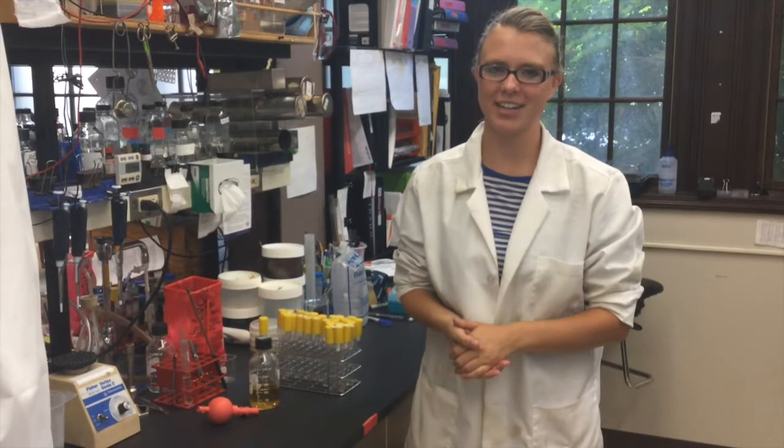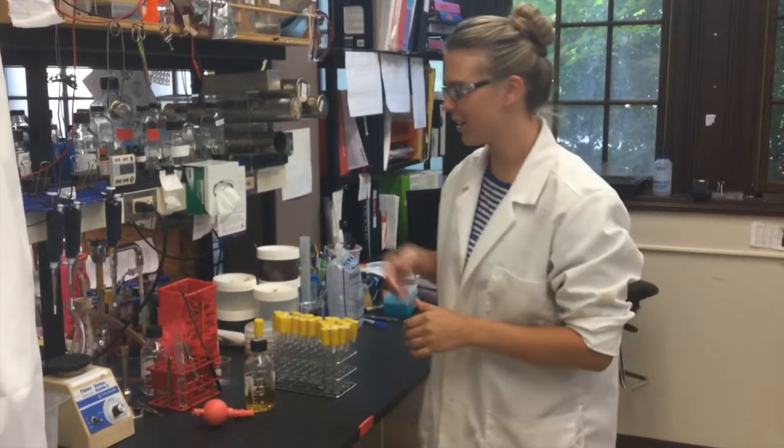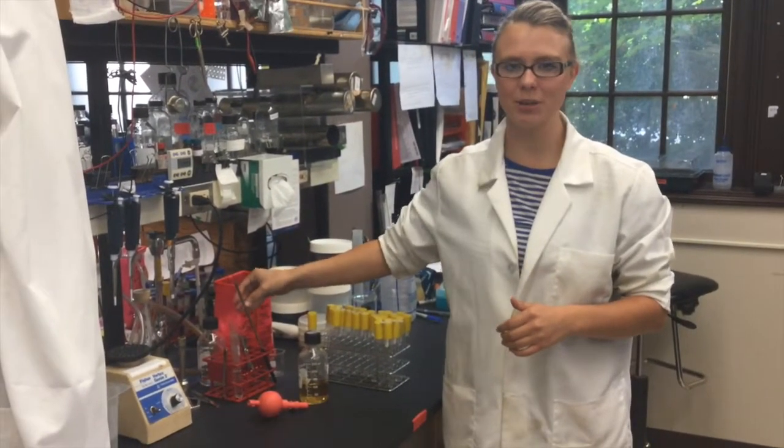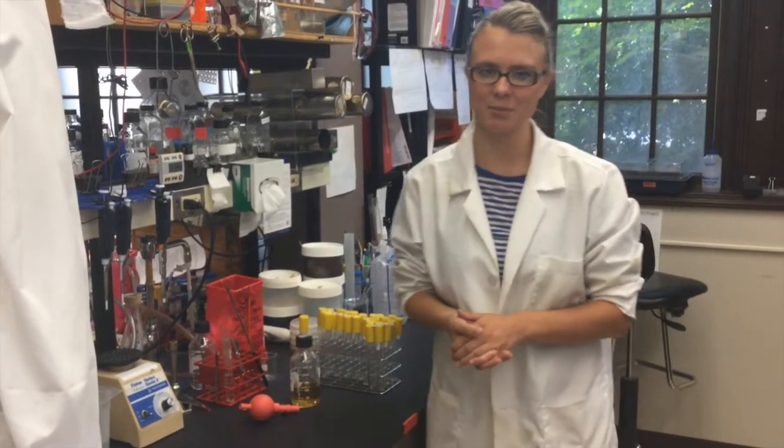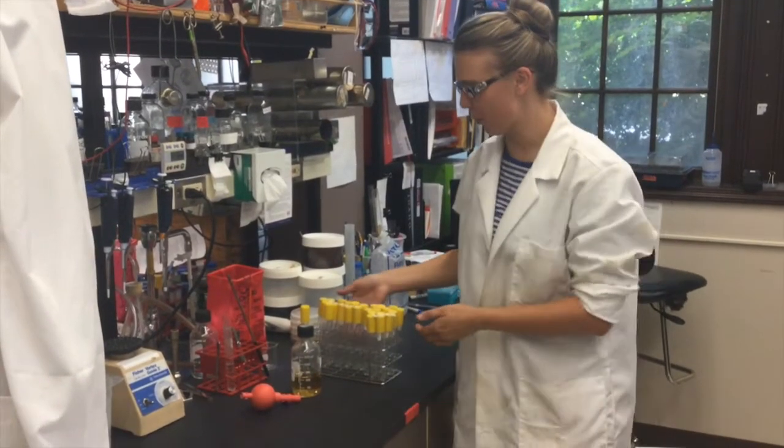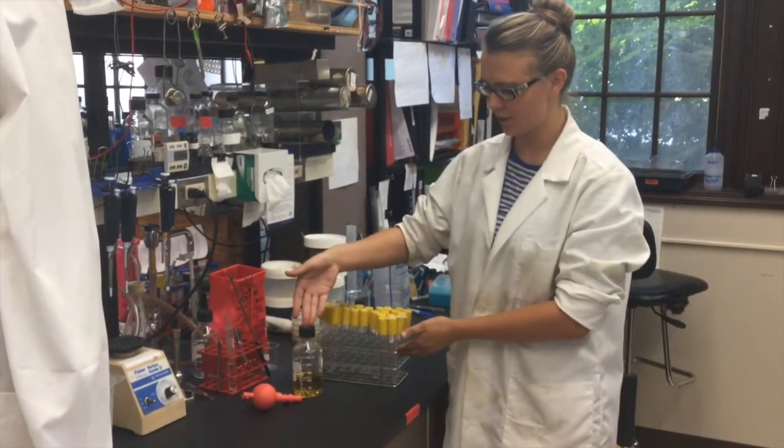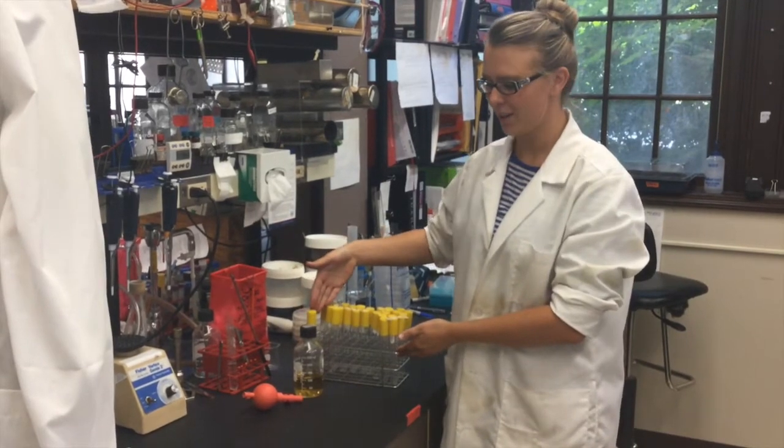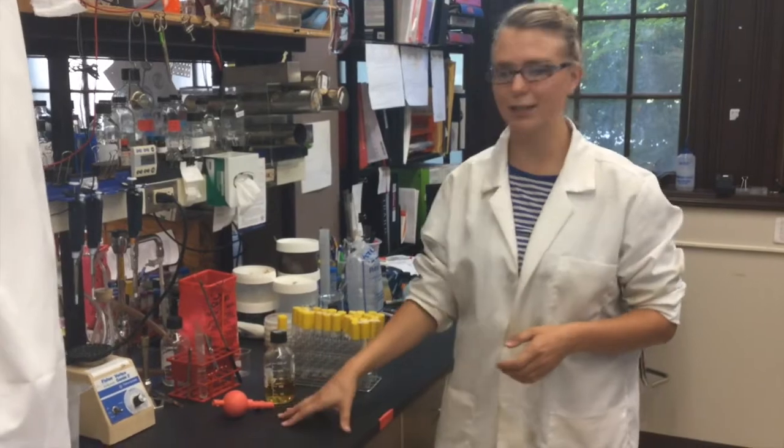Today we've learned various aseptic techniques, primarily how to flame a loop which can then be used for inoculating various materials. We've also learned how to properly pipette liquid material from one jar to another. Now that we're done though, we must return all of our equipment to the proper place and clean our workspace. Don't forget to properly use these aseptic techniques in the biology laboratory when necessary.